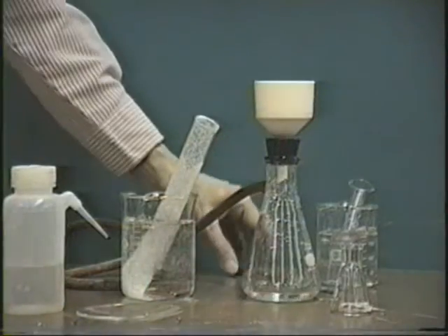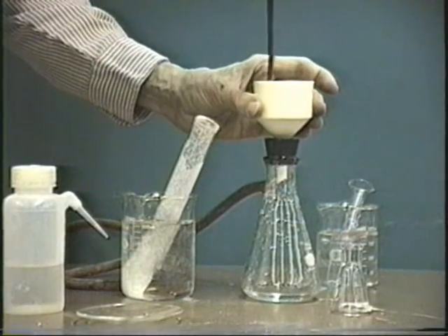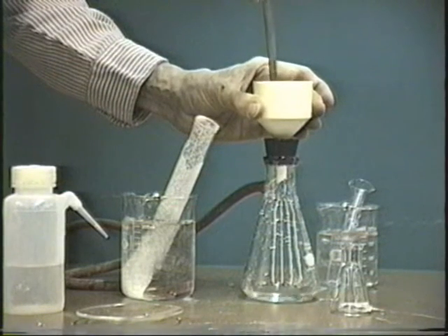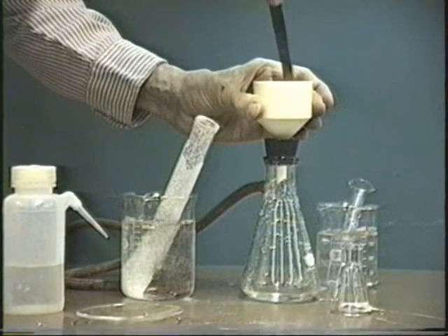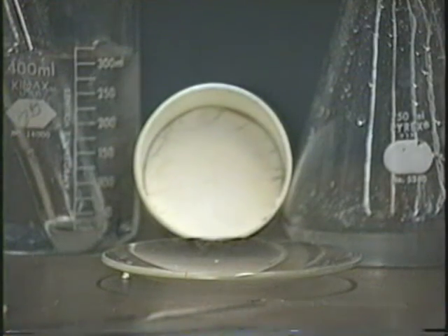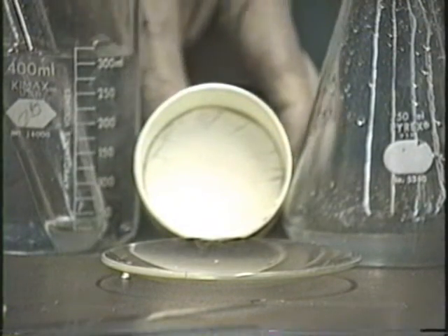Now a brief note on filtering. When the suction is complete, if we hear a hissing noise like you're hearing now, I'll go around the edges of the Buchner funnel, pushing down the filter paper to make sure that it is in place. After drying under suction for about 5 minutes, you're ready to take your sodium bicarbonate and put it on a watch glass to dry until next week.